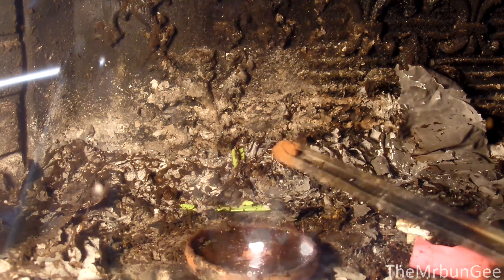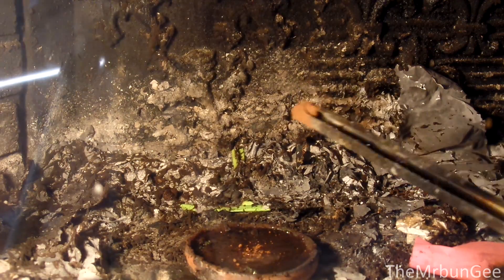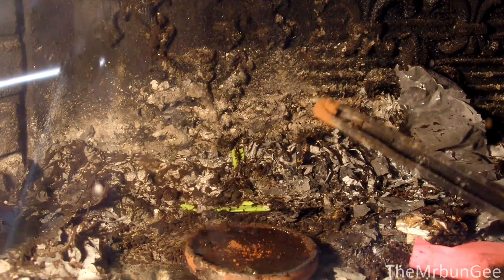I added cacao powder to the pulp as a powdered fuel source, and you can see that some heptoxide was left in the dish, but not usefully much.